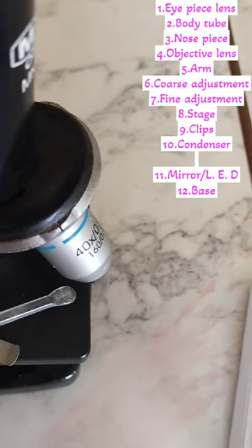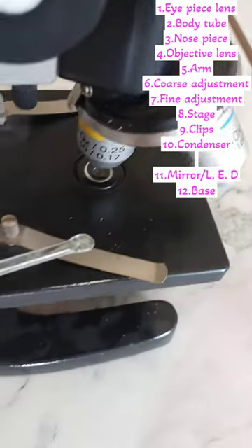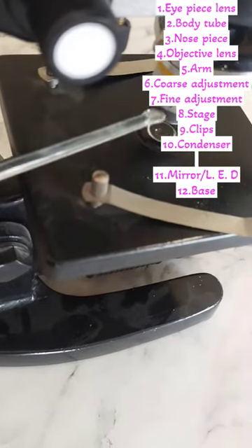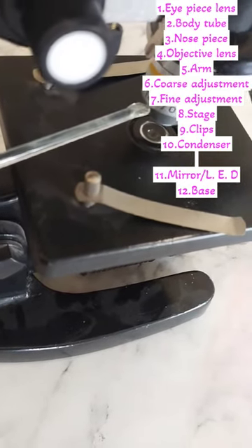Normally there are two lenses, but there are more than two spaces in the nosepiece. You can fix the extra objective lens in those spaces.